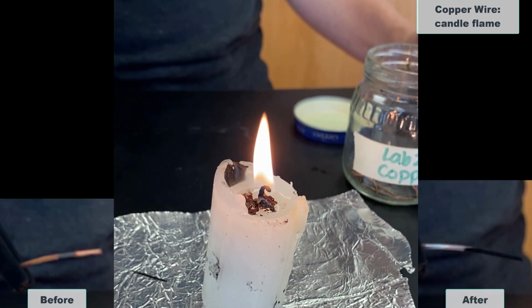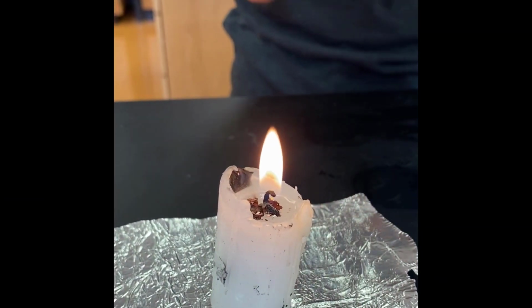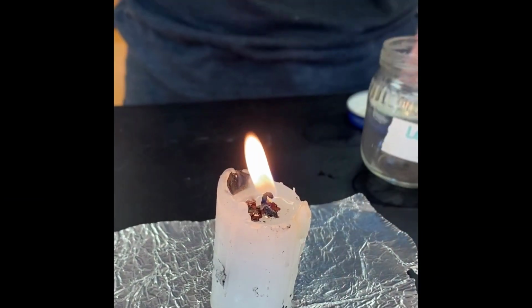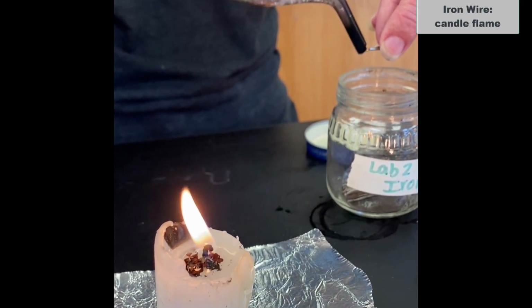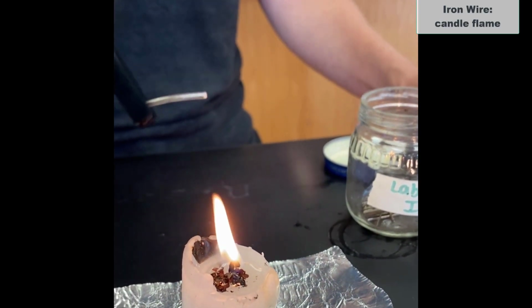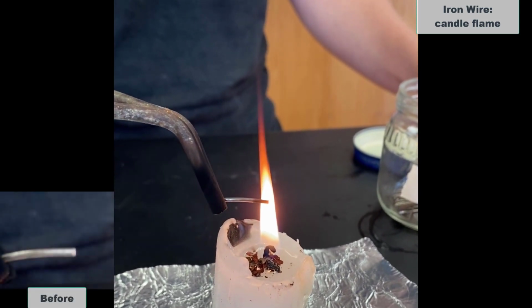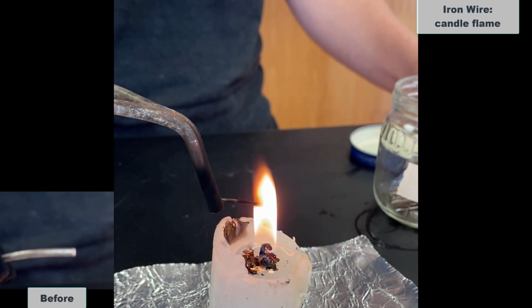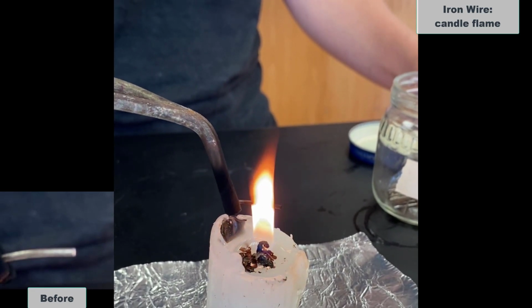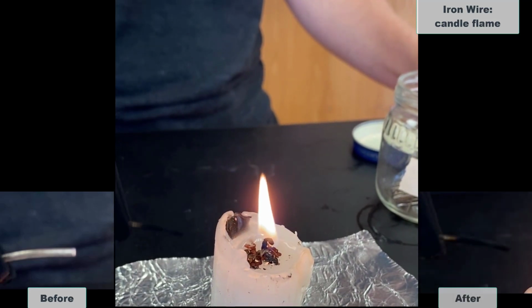And now we're going to try iron. Again, iron is in the form of a wire. So here's what it looks like before we start. And afterwards.